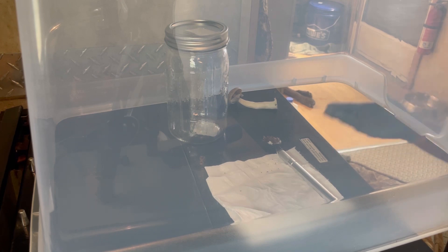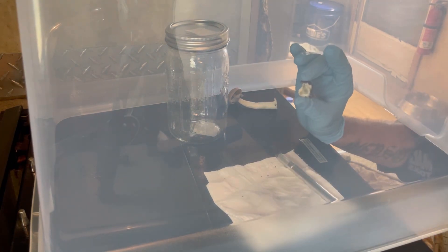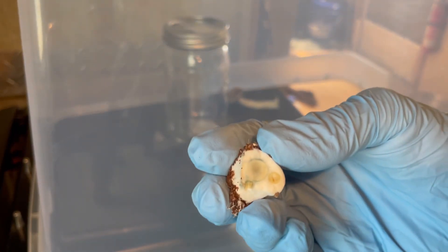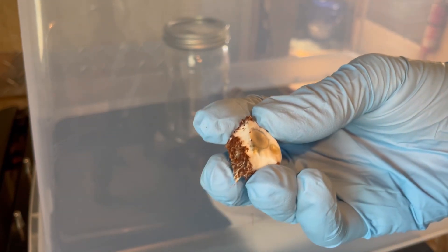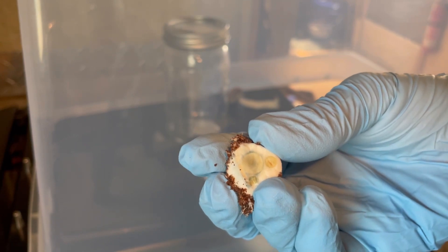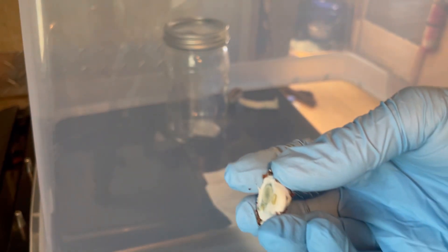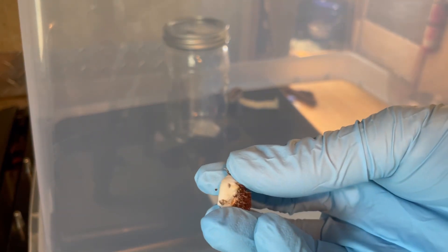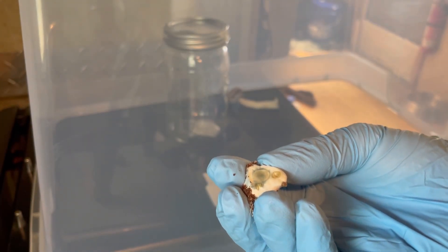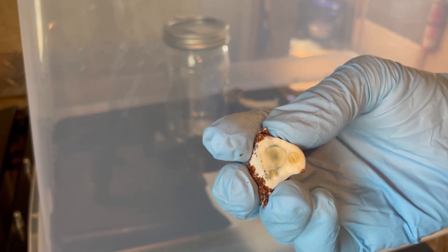There will be contamination eventually, but I want to point out — I'm going to throw that away, it's just trash. And you can actually watch it turn blue while I talk. So since it's just trash, why not use it? That's what I'm doing — using these to re-inoculate corn. So far it's been working great and it's very cost effective. See how it's turning blue?